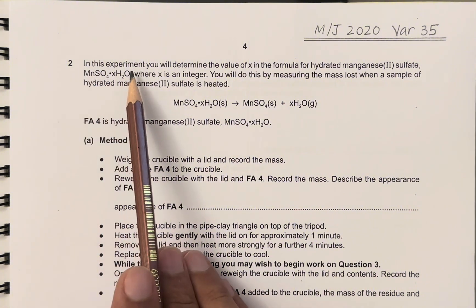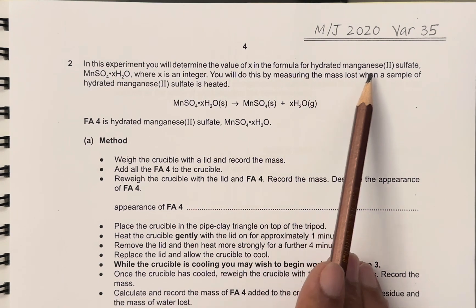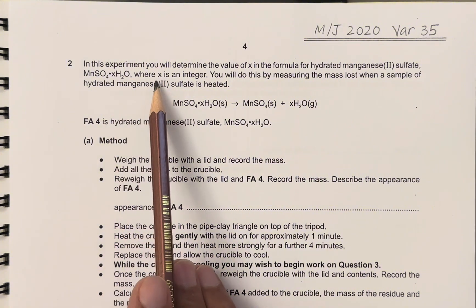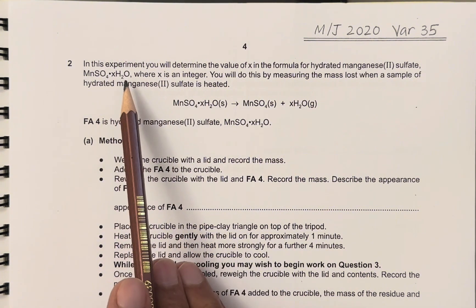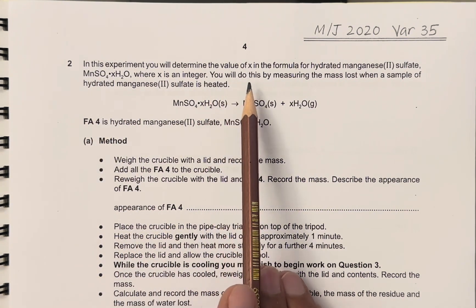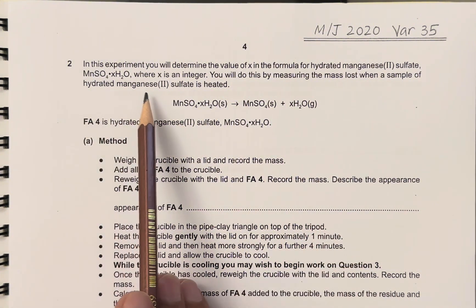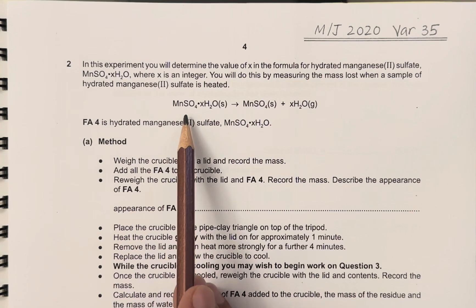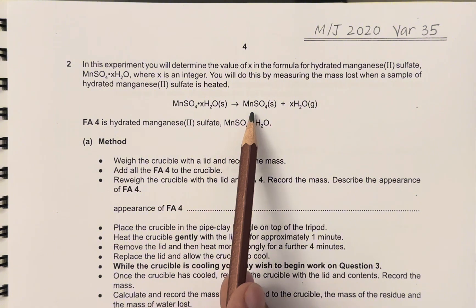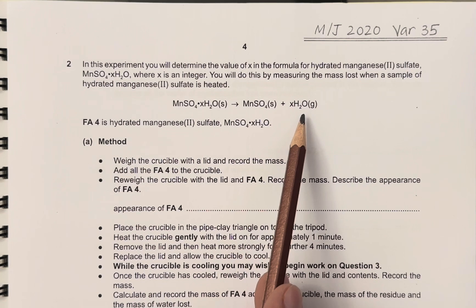In this experiment, you will determine the value of X in the formula for hydrated manganese 2-sulfate, whose formula is MnSO₄·XH₂O, where X is an integer. XH₂O represents the water of crystallization molecules present in the compound. You will do this by measuring the mass lost when a sample of hydrated manganese 2-sulfate is heated. Hydrated manganese 2-sulfate crystals are heated to form anhydrous manganese 2-sulfate solid, and water of crystallization is lost in the form of steam.